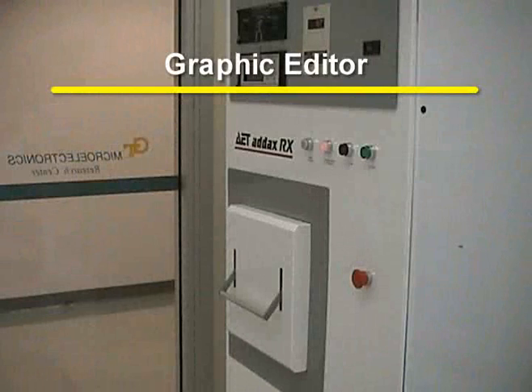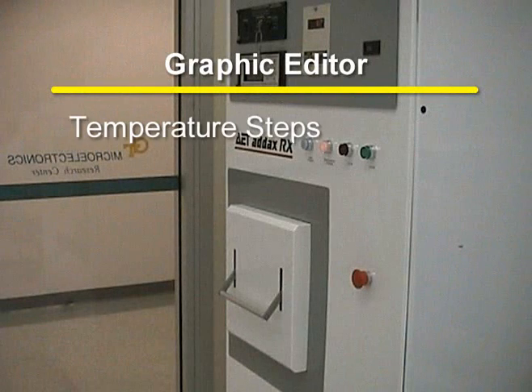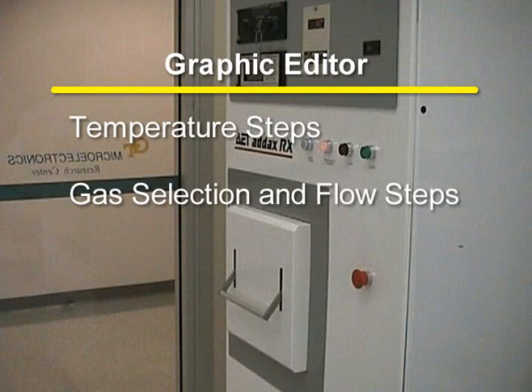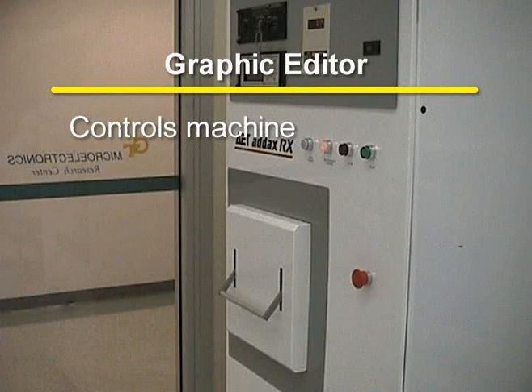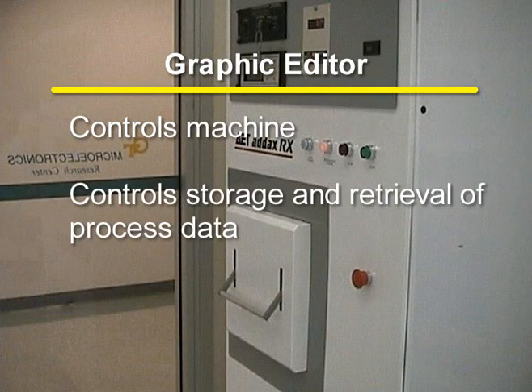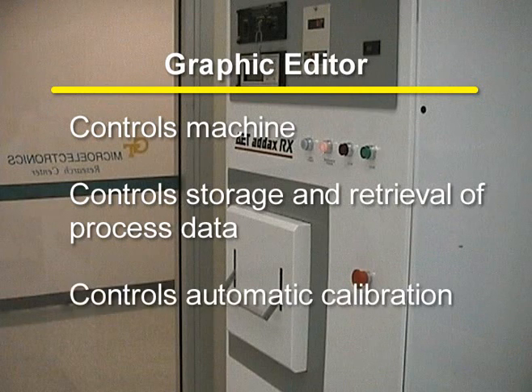Programming of the recipes with a full-screen graphic editor for temperature steps, gas selection and flow steps, pressure steps; control of the machine for the execution of the process with actual data graphically displayed in real time. Next, it also controls storage and retrieval of all or part of the process data. And finally, it controls automatic calibration.